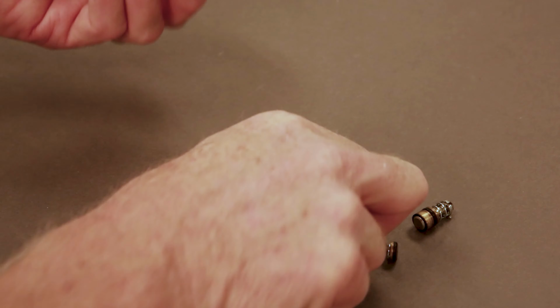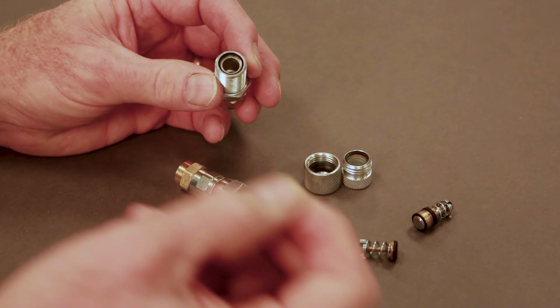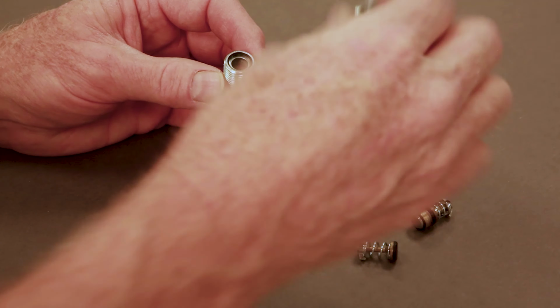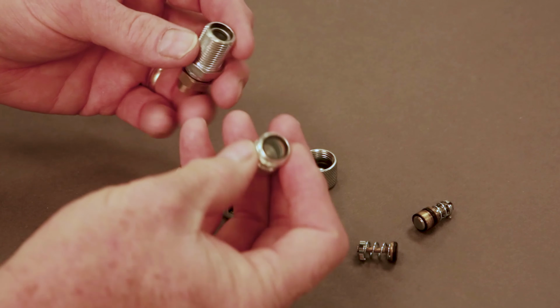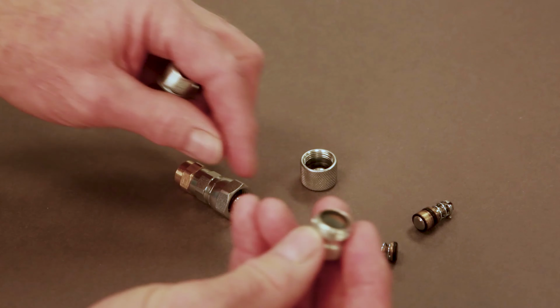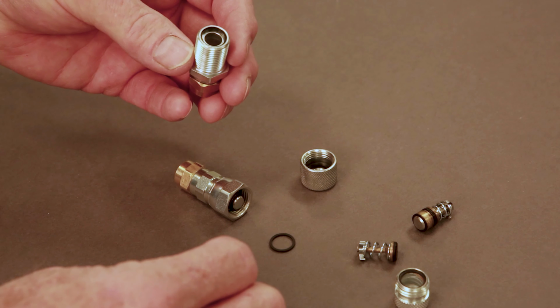There is also a face seal that goes in here. That face seal will sometimes go bad over time and need to be replaced. If you don't have access to one, but you do have a spare cap, the face seal in that cap is the same one, and so you can pry that out, put it into the male end of the fitting.